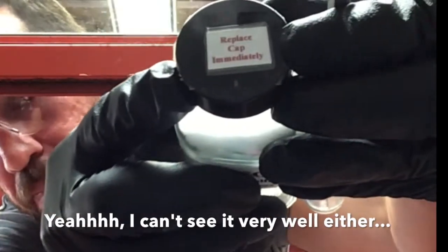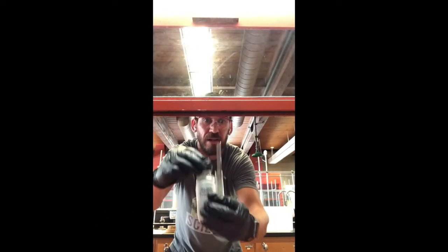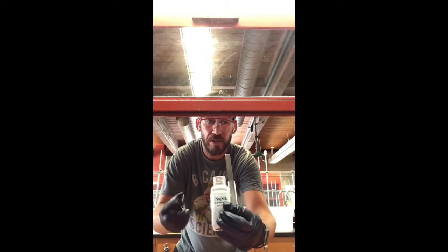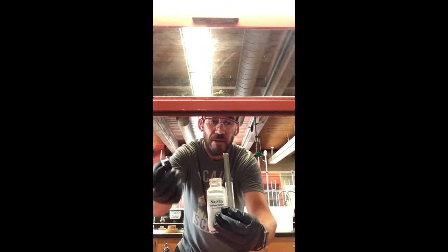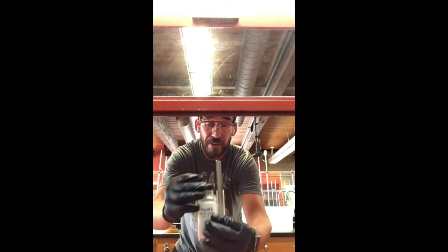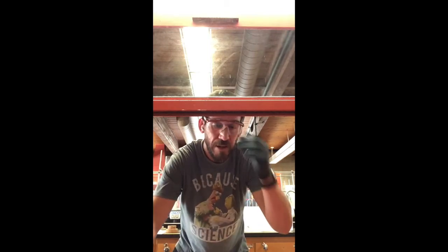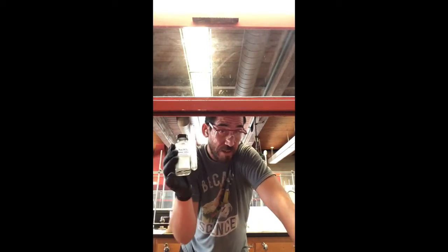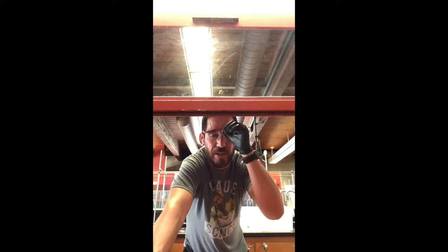Replace the cap immediately, because when you take it off, especially in Santa Barbara, there's all kinds of water in the air. You want to put that cap back on when you're done using it, because water from the atmosphere can be absorbed into this sodium sulfate, because that's what it does. That's its job, right? It dries things.